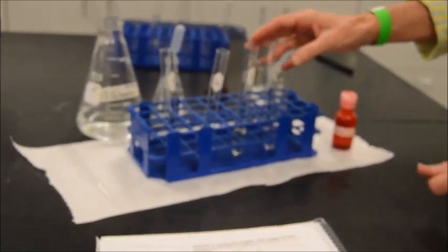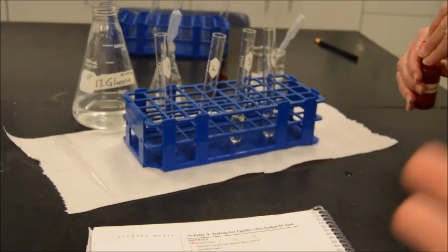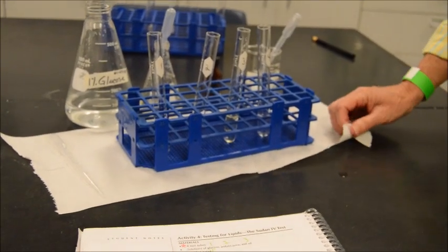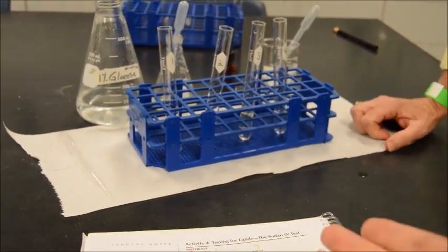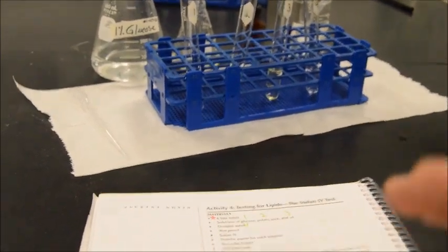And mind you, what we're trying to do here is get at the concept that in a laboratory setting, say you're working for an environmental lab, and they were asking you to identify the presence of certain chemicals within a soil sediment sample or what have you, anything along those lines, everything has to be treated identically for continuity. All right, we have to control where everything is and what's happening where.